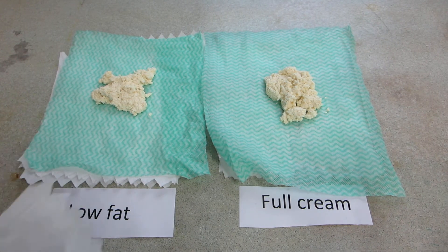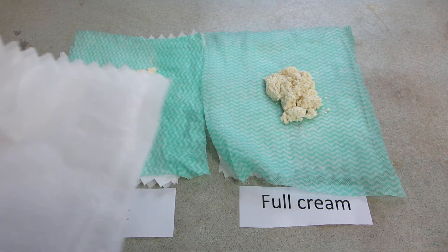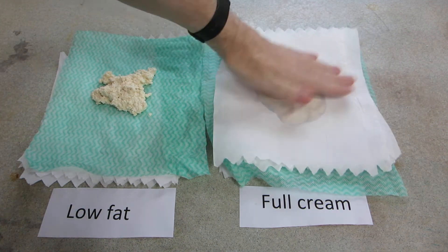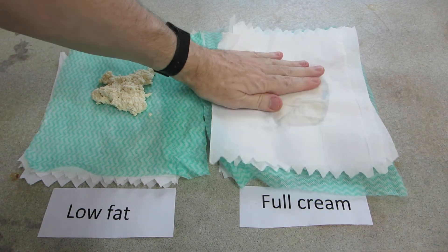The next stage is to press the casein between some paper in order to dry it out as much as possible or remove as much of the liquid before leaving it to dry in either a low-temperature oven, a drying cabinet, or just a warm sunny window sill by a radiator.